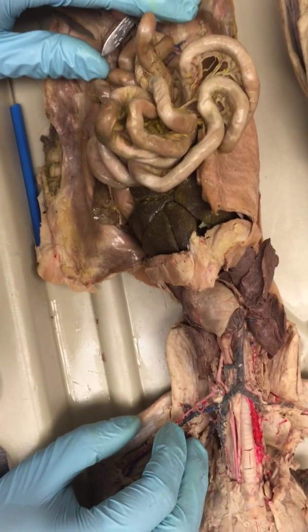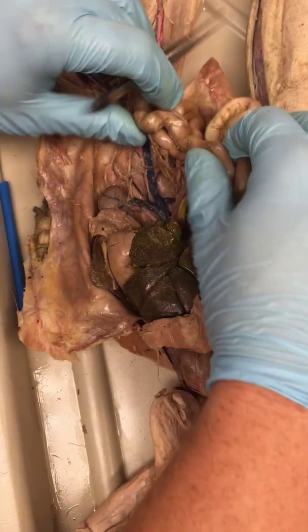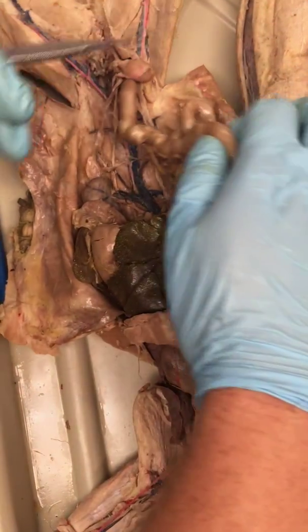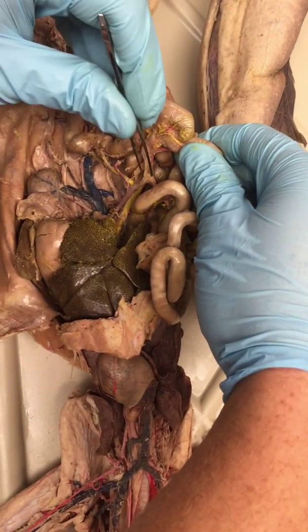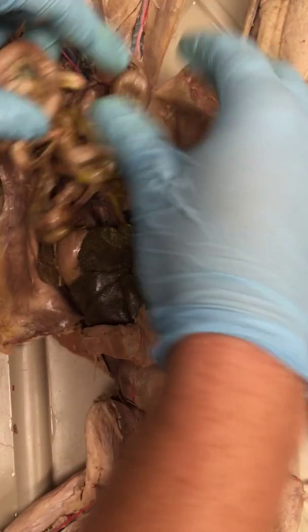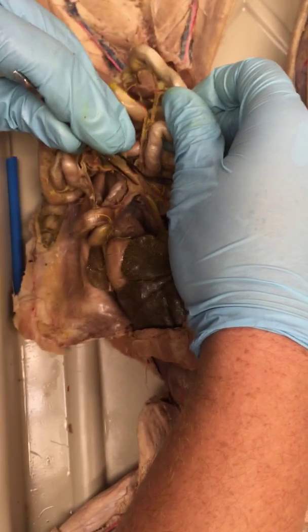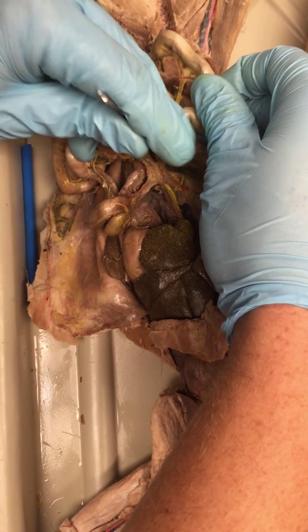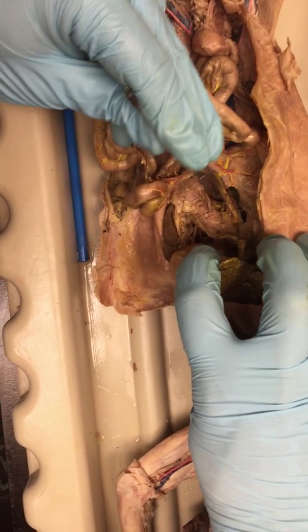Okay, we're almost done. That was all the arteries of the intestines. Now we've got to do the veins. Now the veins, there is no left, right, or middle colic on the veins. There is just an inferior mesenteric, which is where the left colic would normally be, and an ileocolic, which comes up here into where the ileocolic and the right colic would normally be. And then, of course, you have all of these mesenterics and intestinals come up here, and they all get together with the posterior pancreaticoduodenal right here. They all get together to become this guy right here, the superior mesenteric.